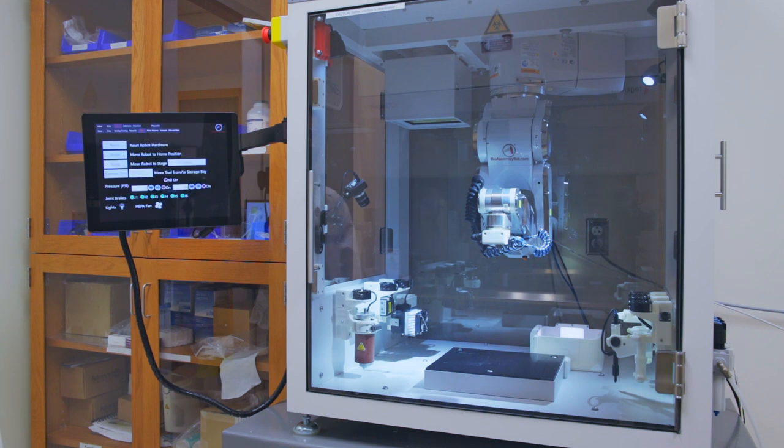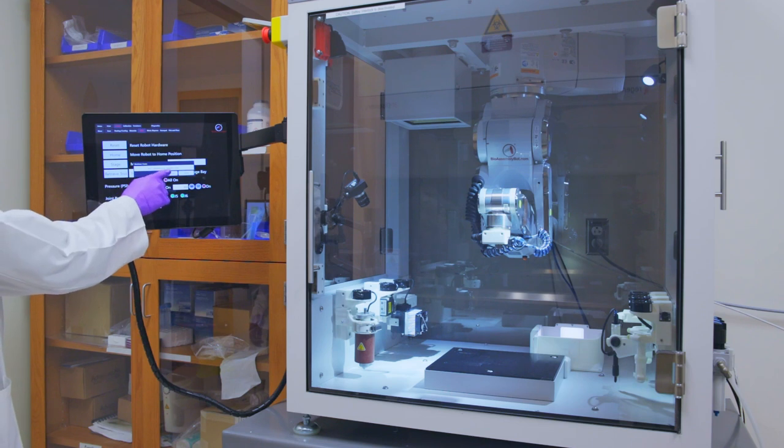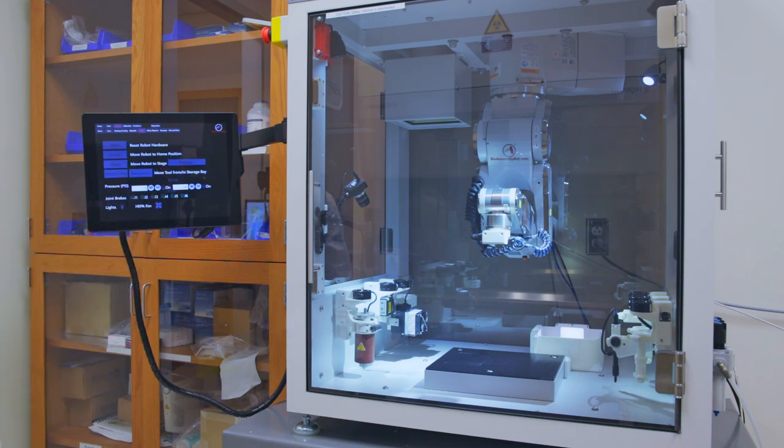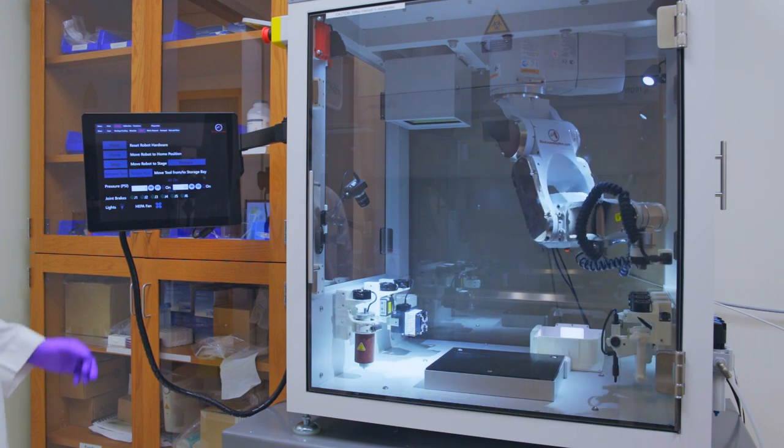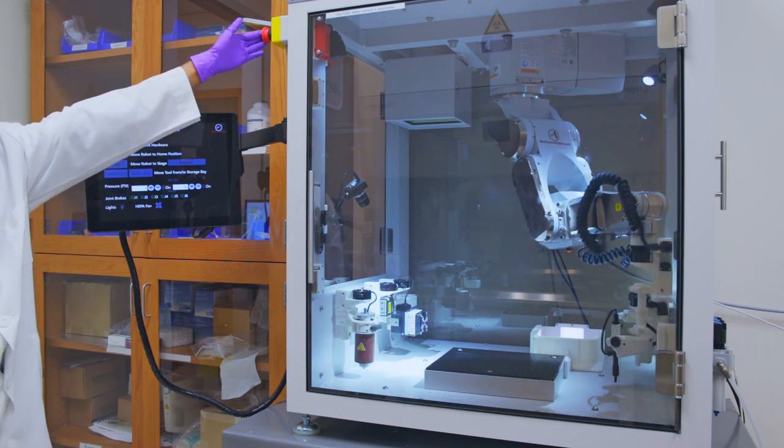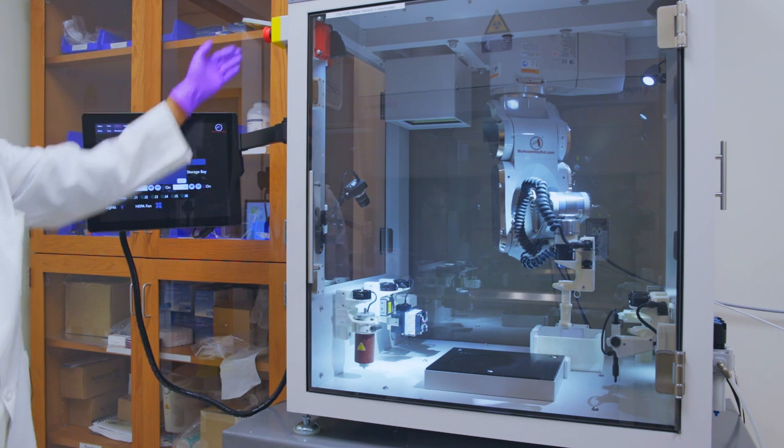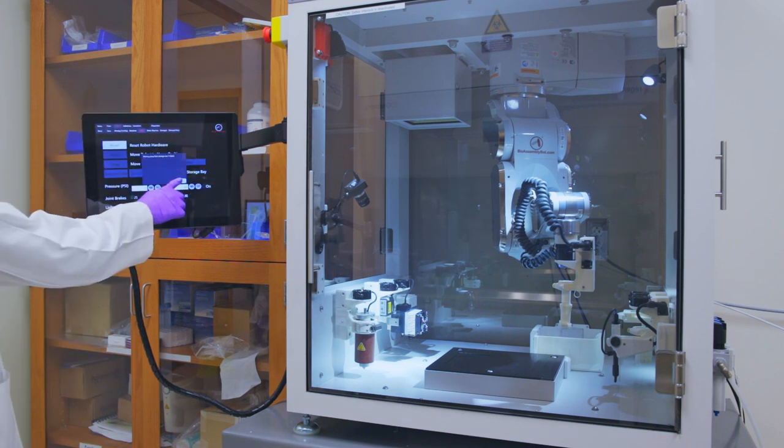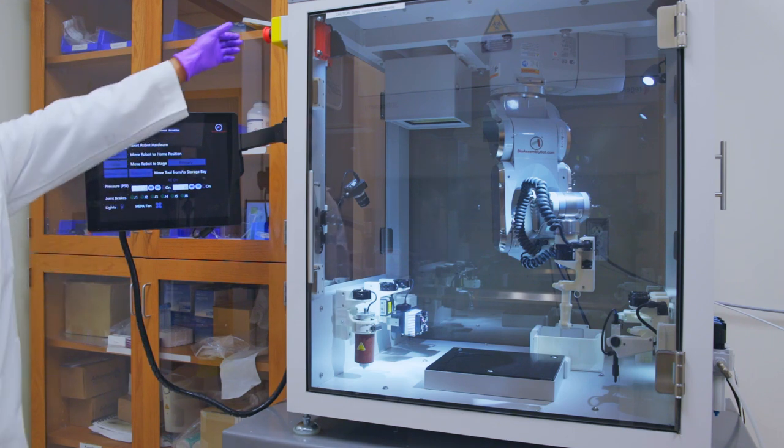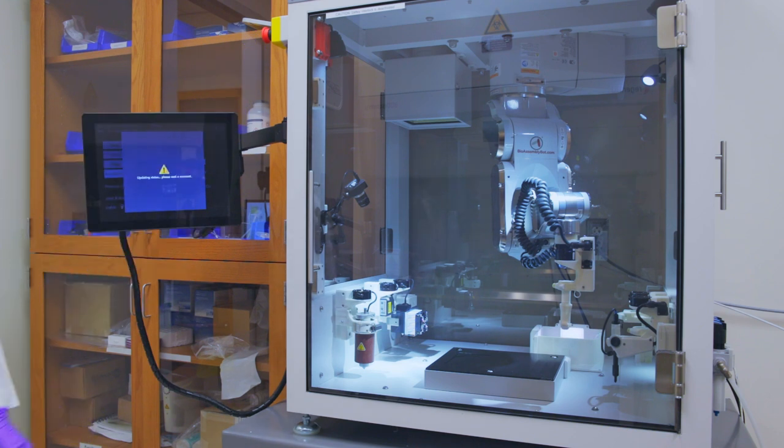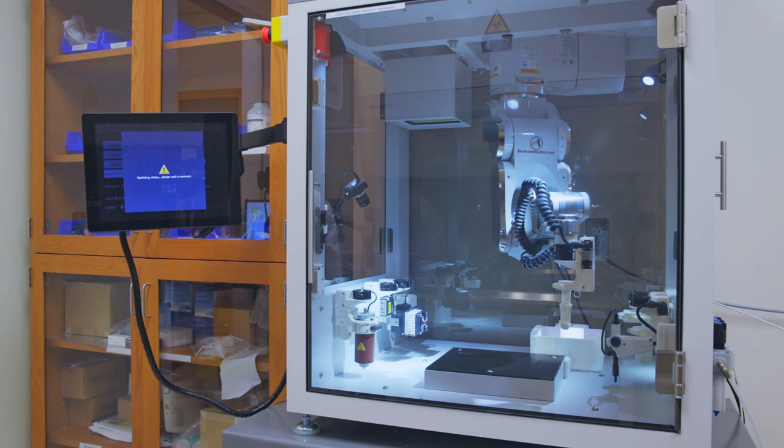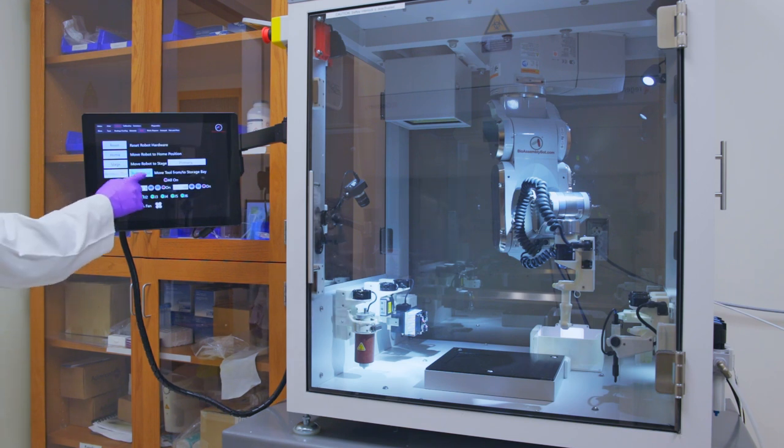Here is an example of a use case scenario. Here we want to retrieve a tool, and while it is picking up and moving, if we think it is going to crash into something, we can stop the arm movement by pressing the emergency stop. The robotic arm is going to stop immediately. To resume the operation, twist the knob, and we can resume the operation.